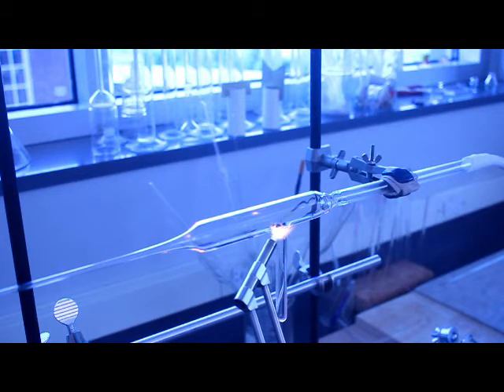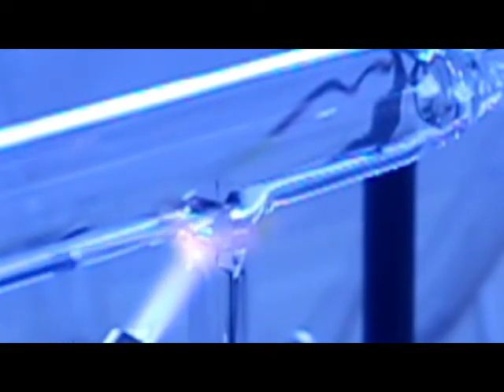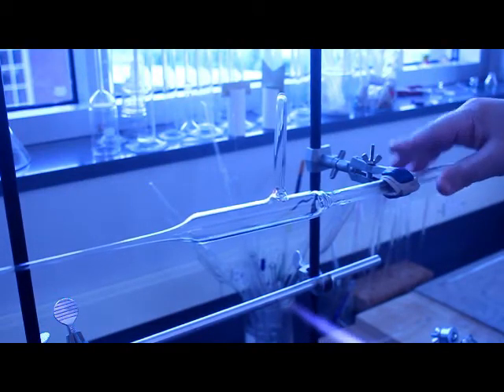This is something that by getting more practice you kind of get into a rhythm of doing glassblowing and instead of overthinking it, it becomes second nature. Where I could have saved myself a tremendous amount of pain and suffering is in the stick when I put the small tubing onto the larger tubing. If I would have focused a little bit more and got it centered perfectly, then I wouldn't have to go through all of this where now I'm just trying to clean it up a little bit. So again that's something that it's just practice. But I do want all of you to see this video warts and all.